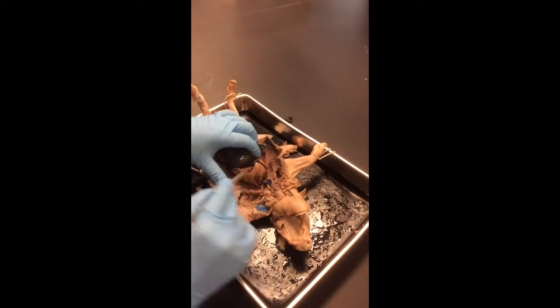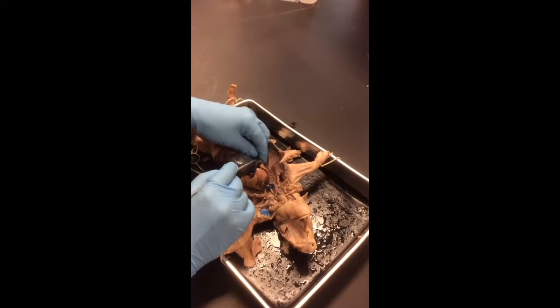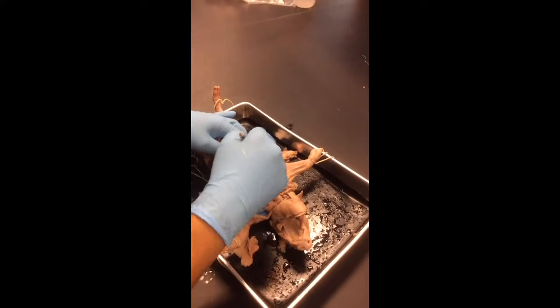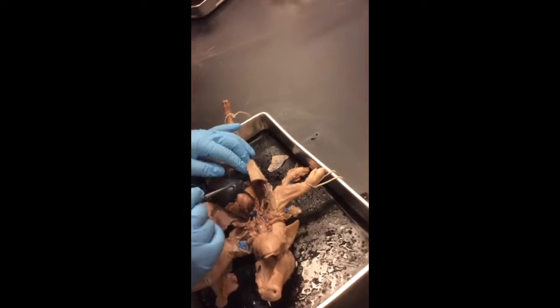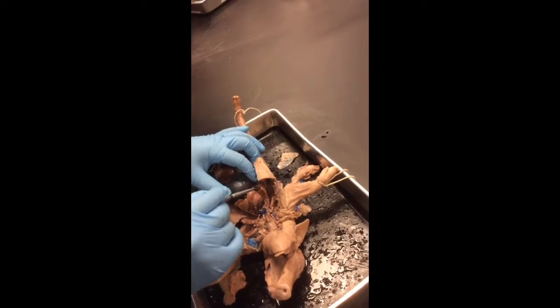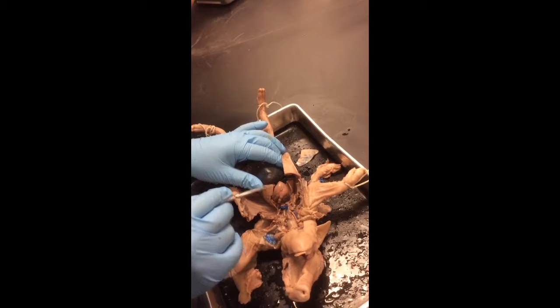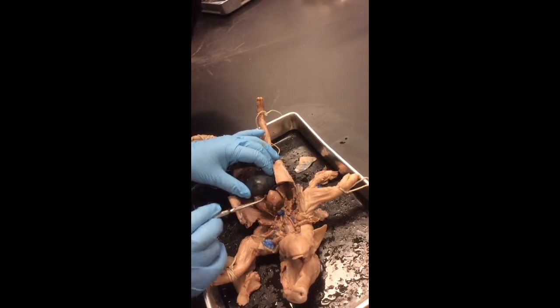Okay, the diaphragm. Mine doesn't really have it because it got ripped through, but here's a piece of the diaphragm right here. This blue thing right here. This is the muscle, right? Skeletal muscle, right? That contracts and relaxes to let the air come into the lungs and out. Here are the lungs, right? So yeah, heart and lungs. So here are the heart and lungs.